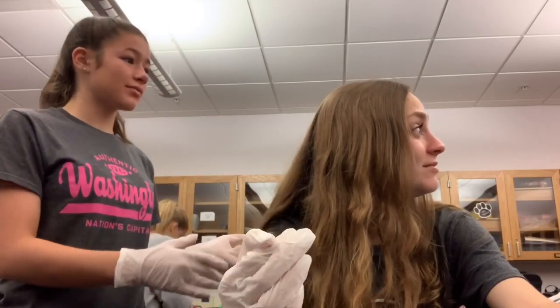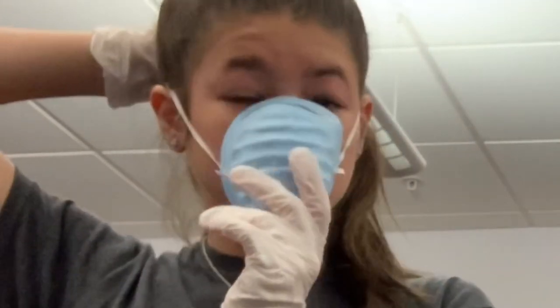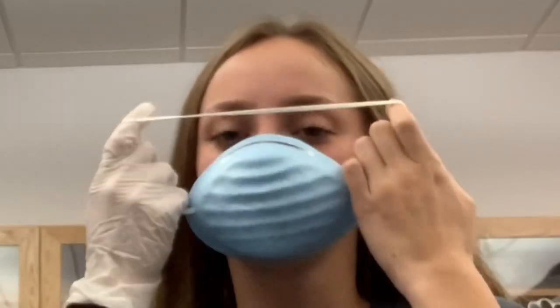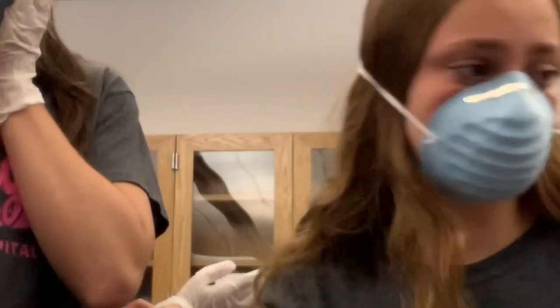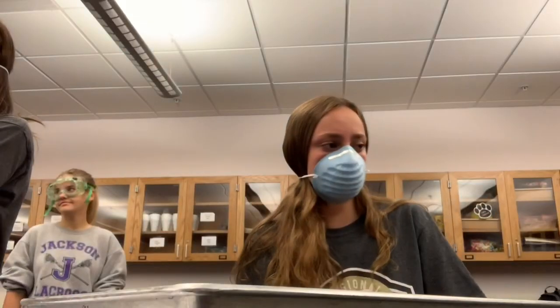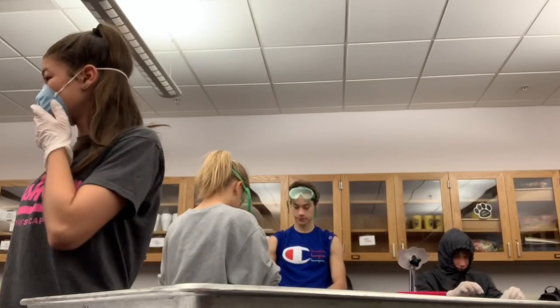Stabbing and slicing is disgusting. I cannot — don't use that word, please. Wait, we need to throw up. I actually feel like I'm going to throw up already. It's hot. I can't breathe. All right, you have your frog. Leave this one — ours, yeah. Now let's go — oh my god! Dude, ours came back to life or something. I can't — everybody needs a bag.